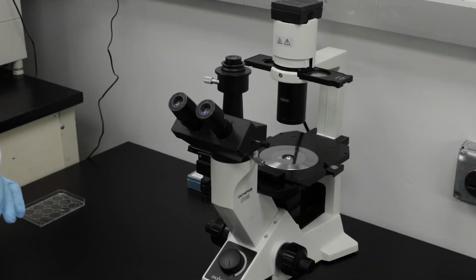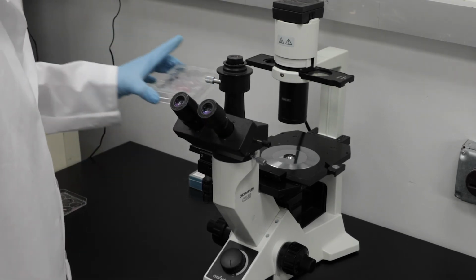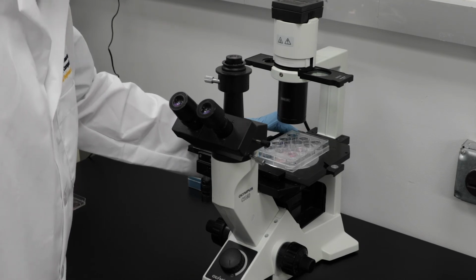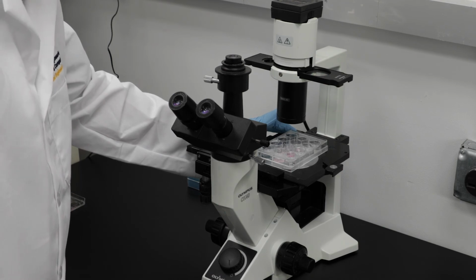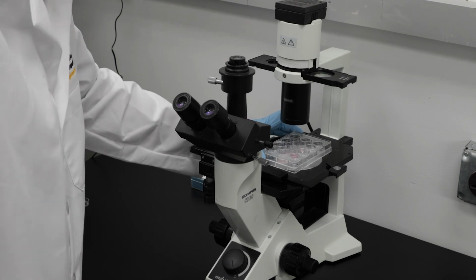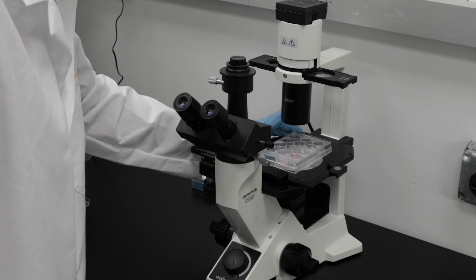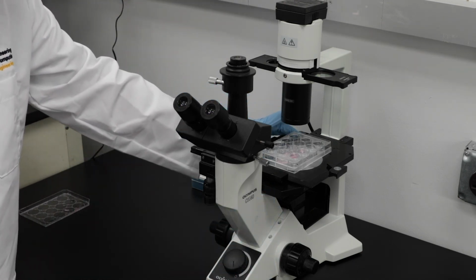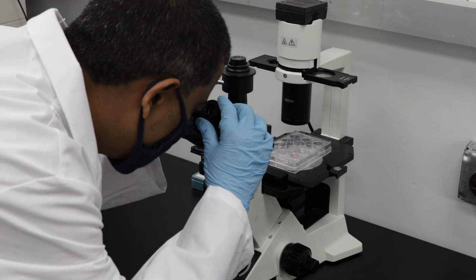All right, so here we have our well plate with the cellular gel constructs already incubated for 5 minutes in a standard incubator. At this point, we have it under a microscope, and we can do our live and dead cell count using the trypan blue that was already mixed in. We have these 4 irregularly shaped, 150 micron thick gel sections, and we want to be able to measure the areas of each of these irregularly shaped sections so we can report the area of these live dead counts.